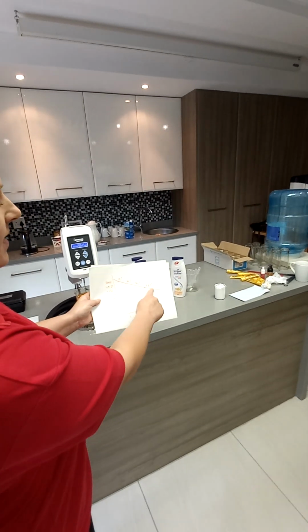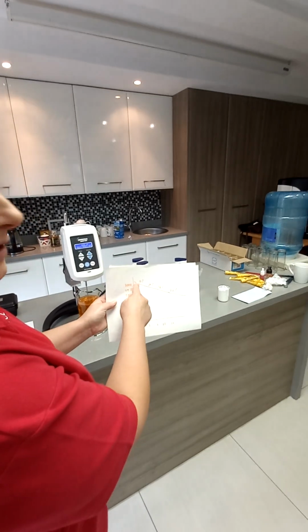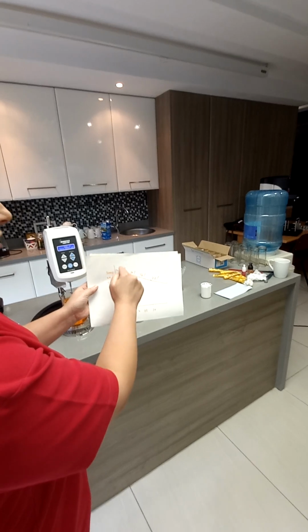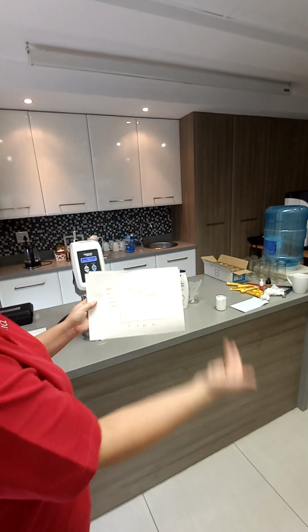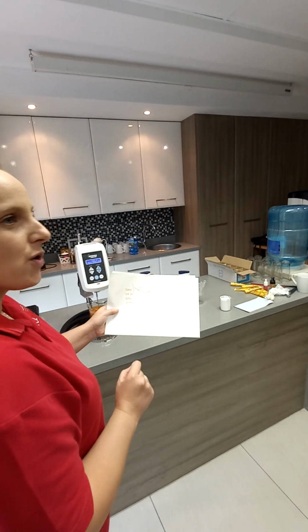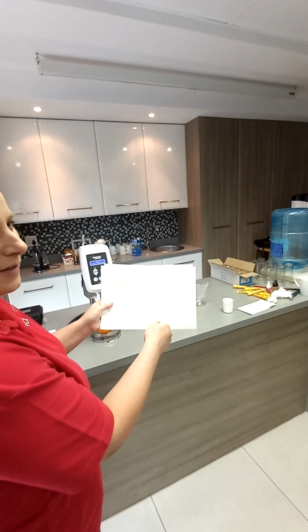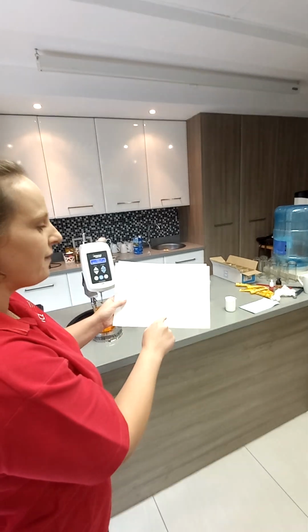Okay, so what I wrote here is the percentage torque I got. That's the viscosity, that's the viscosity, that's the average of viscosity. It all depends. Your viscosity is based on what unit you use, what speed you use, even what the temperature is, what spindle I use. So when you record, you say, okay, my viscosity is 2880 using spindle 5 at 12 RPM.